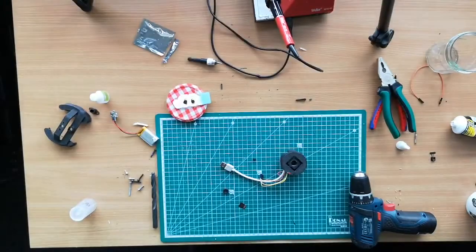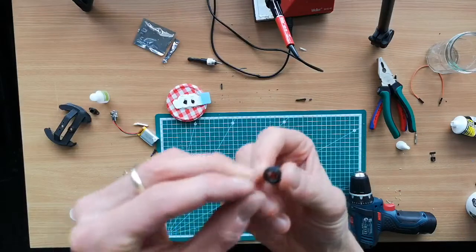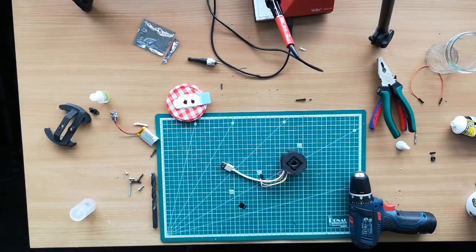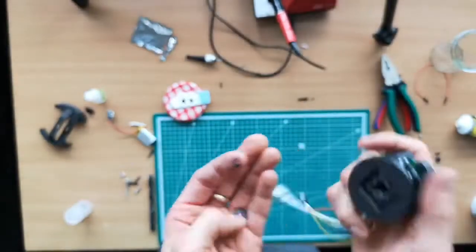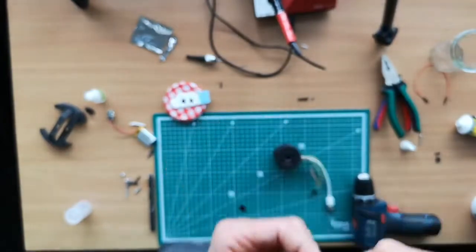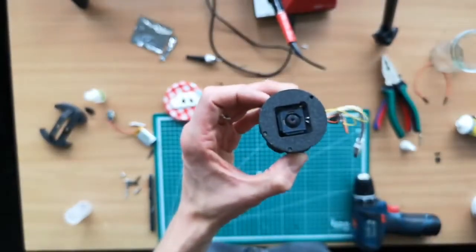So we are dealing with the last remaining bits. We have to mount the lens here inside this adapter for the M12 mount. So the lens here moves inside this adapter, and the adapter then can be placed inside here, like that. And then you're done.